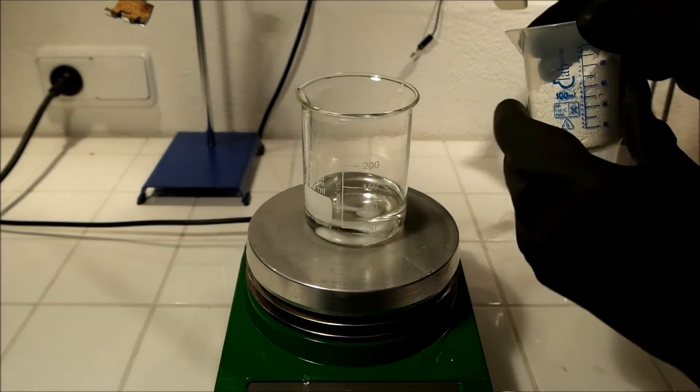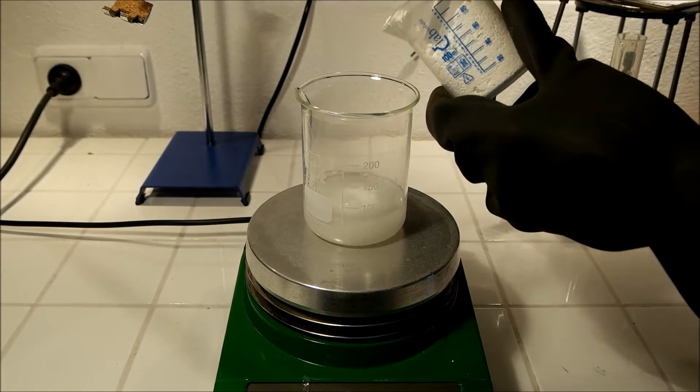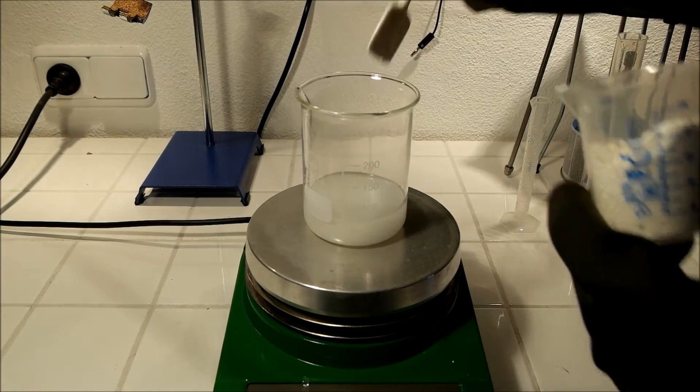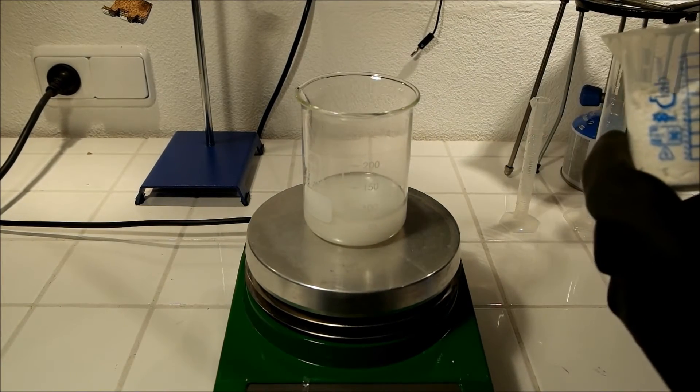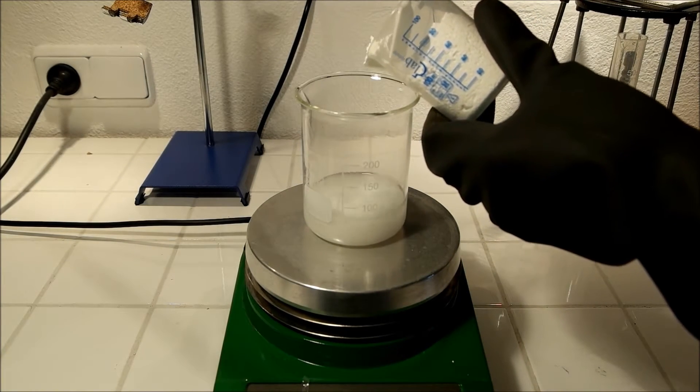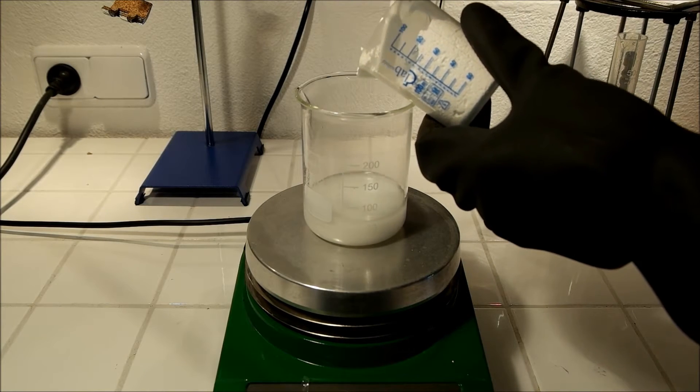Now I start adding the barium carbonate. There's nothing toxic produced in this reaction. It's just, as you saw, water and CO2 gas. This procedure may take a while, but it's worth it.